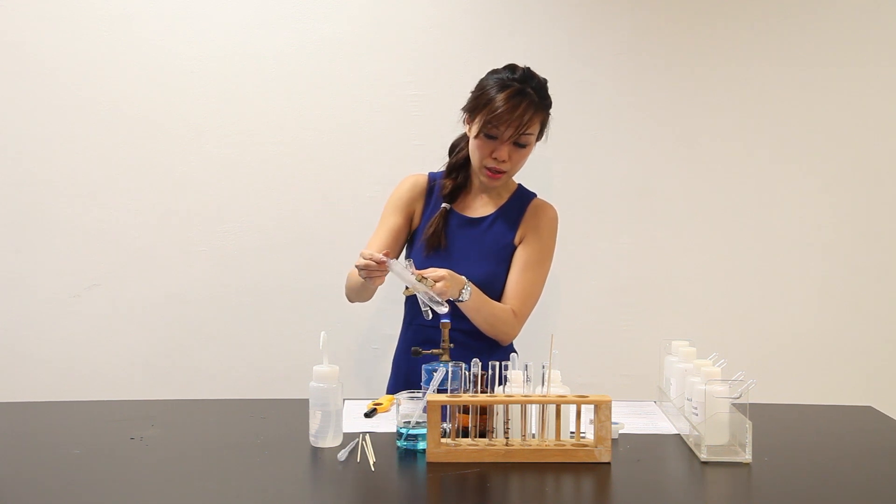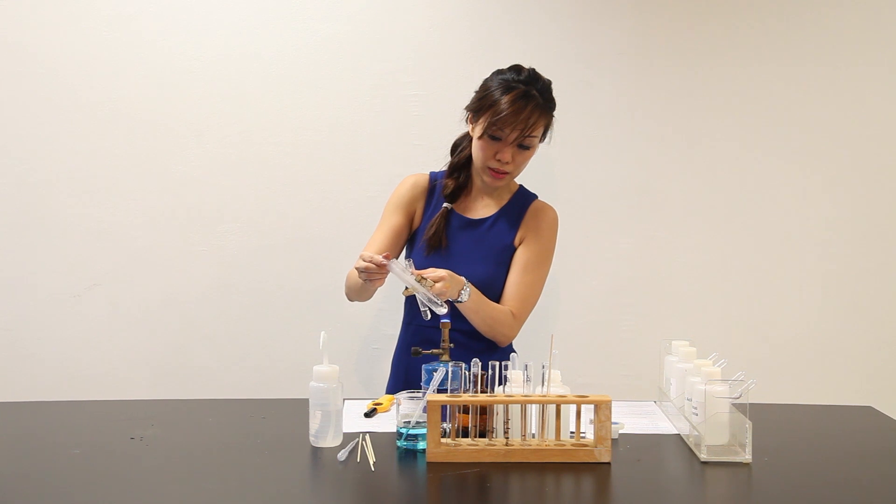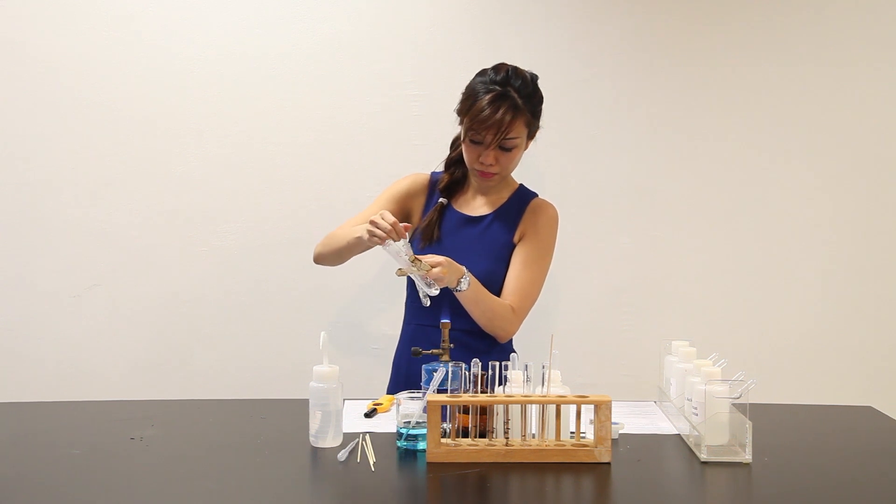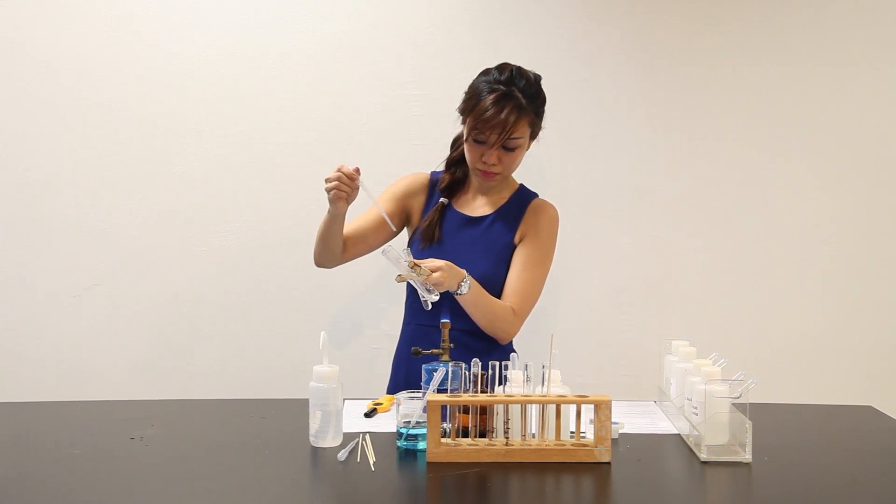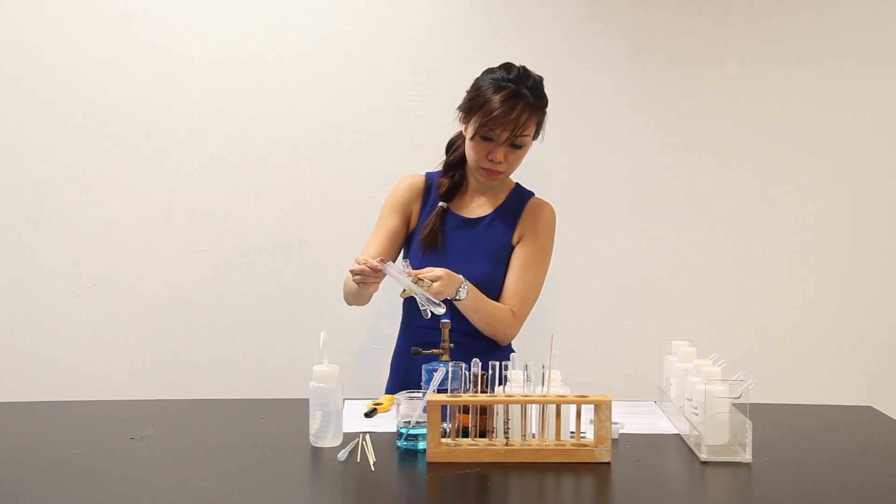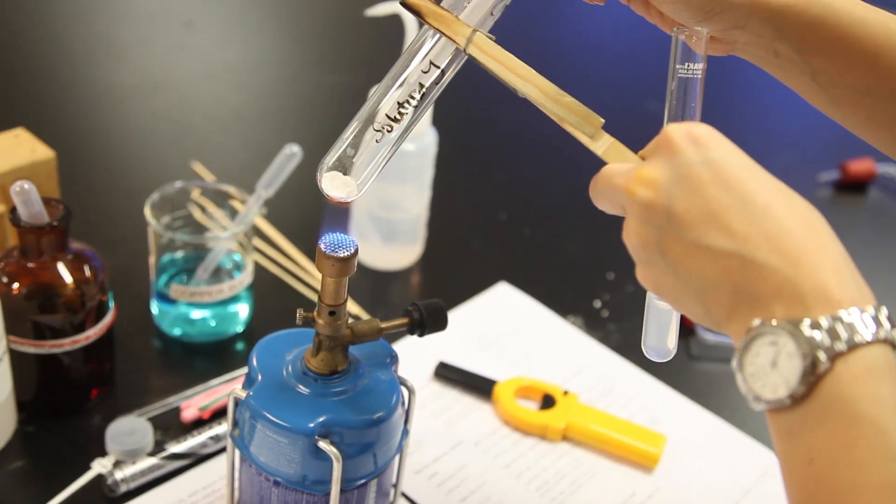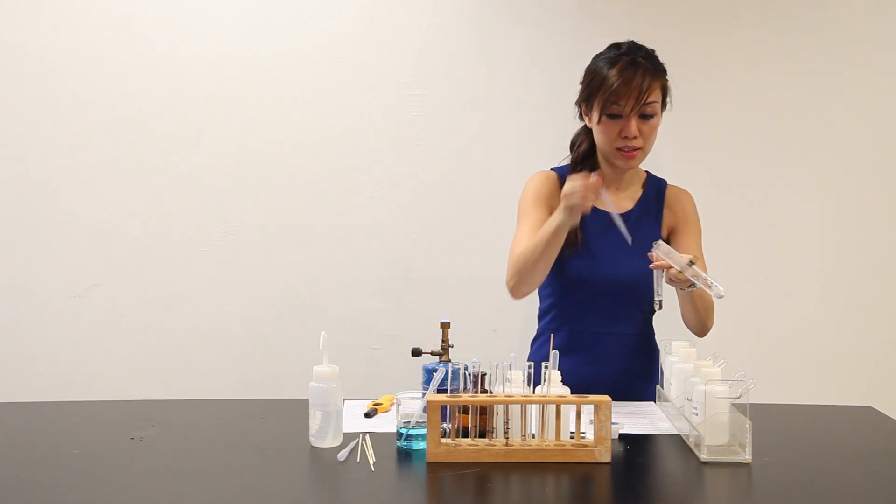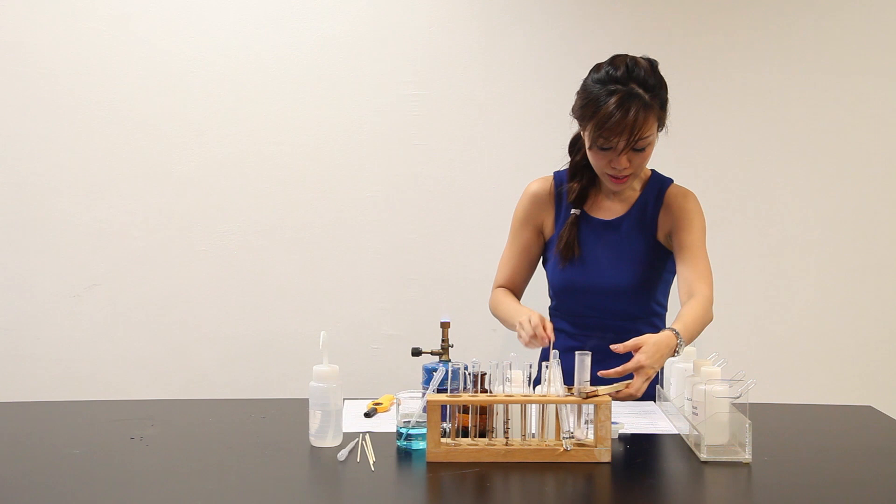Slowly, you will see that the lime water will give a white precipitate. It's like white precipitates. We can stop the entire experiment. And let's move on to the second part.